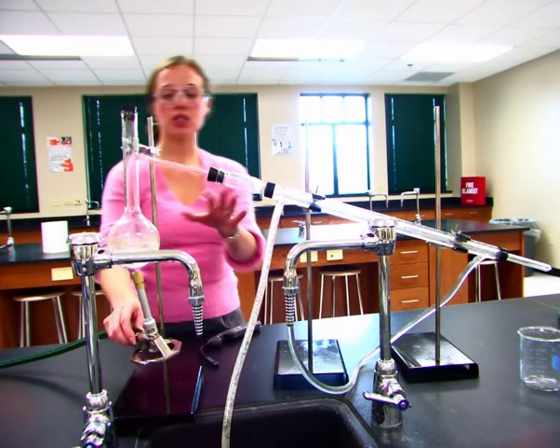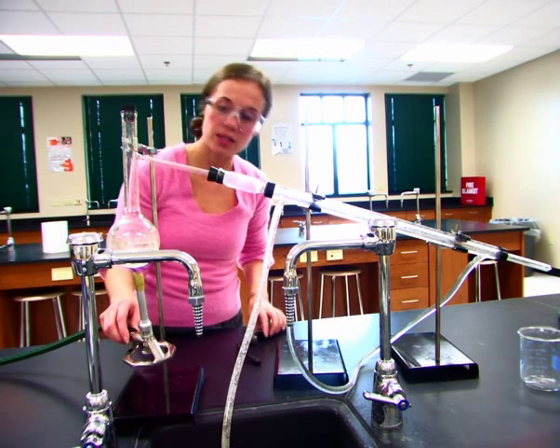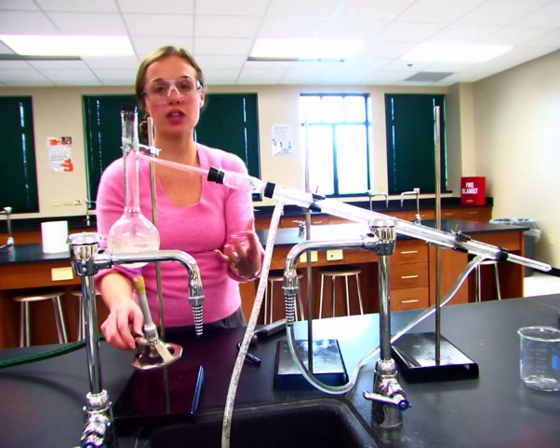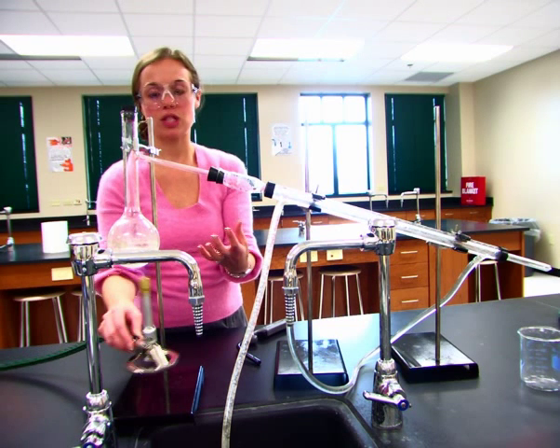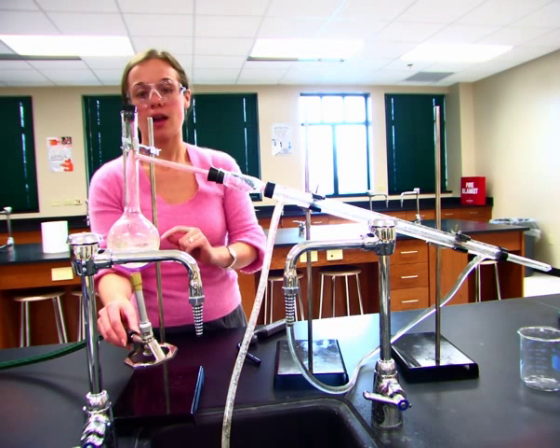And that's because the sugar, we're going to get a darker solution or a more cloudy solution in here because the sugar concentration is going up in here. Now we're not actually adding any more sugar, but we're taking away the water. And when we take away the water, that means there's more sugar per water in there. And this will become more cloudy.